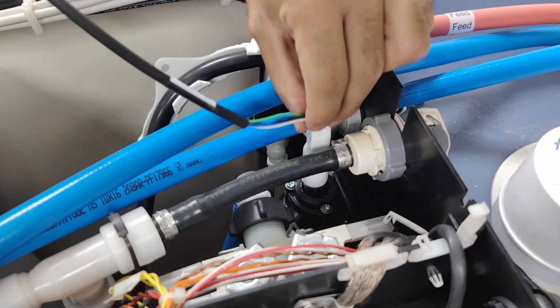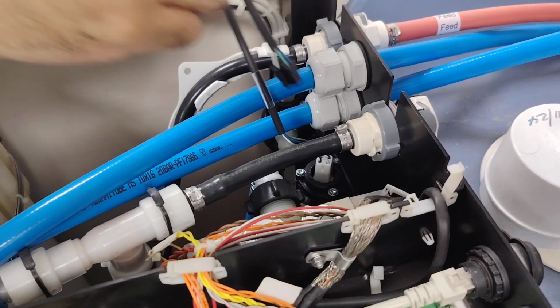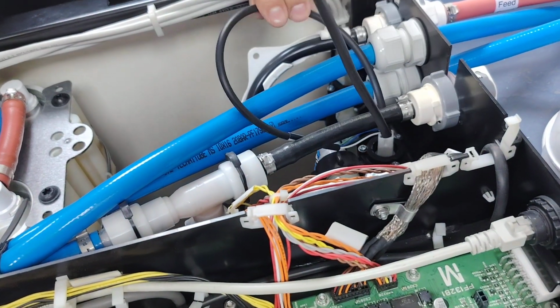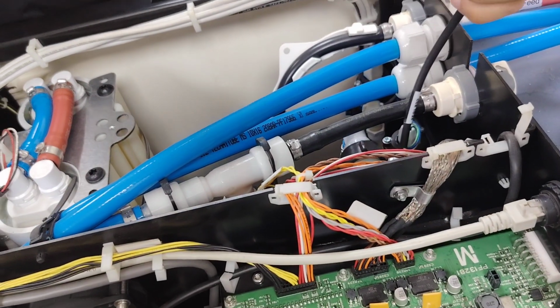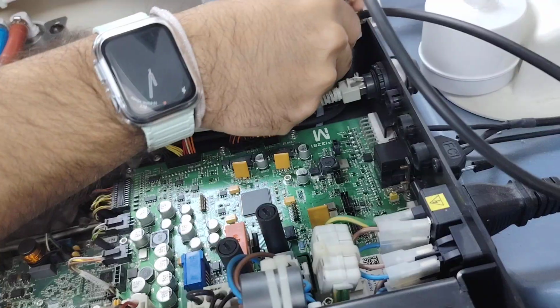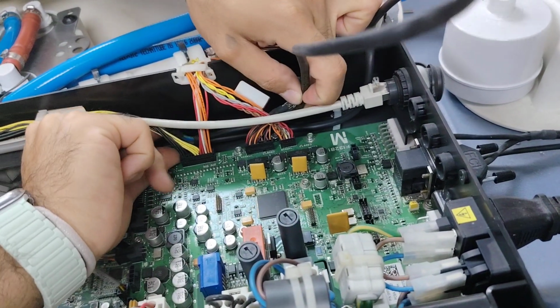And you have to be careful with it, not to jam it. Maybe you don't need to touch that one with your hands, because they're sensitive. But we're used to it. It's mostly the UV lights that are very sensitive. Like I said, we're used to it. These are in their housings, yes.